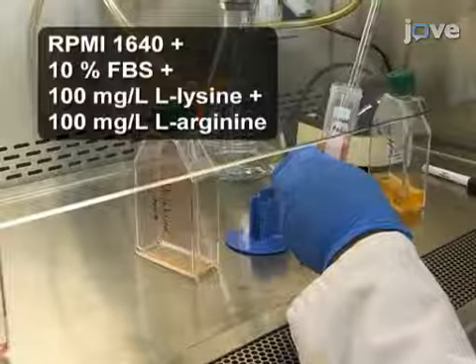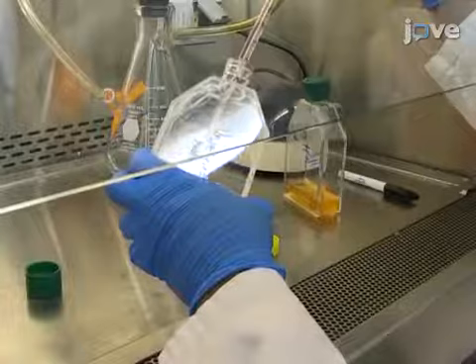Grow the other population in 10 mL of unlabeled medium with 10% dialyzed FBS, L-Lysine, and L-Arginine. Grow the cells for six doublings, at which point the proteins of the cells in the labeled medium are more than 99% labeled with heavy amino acids.